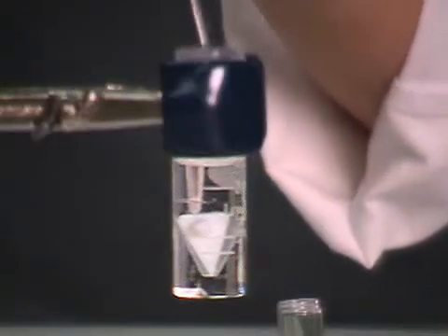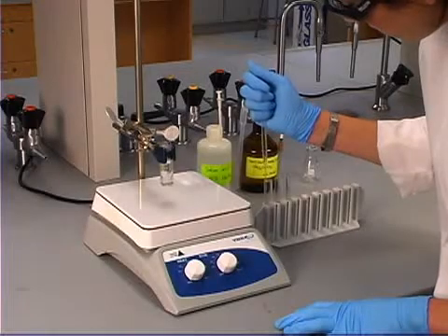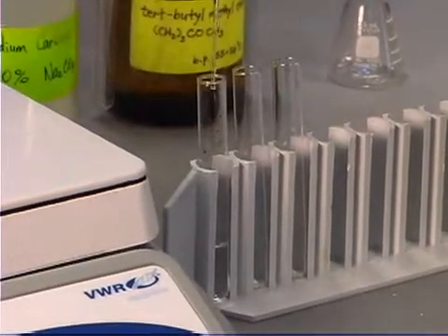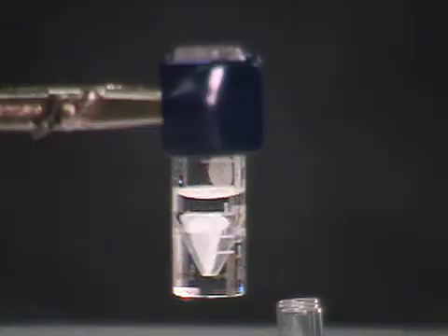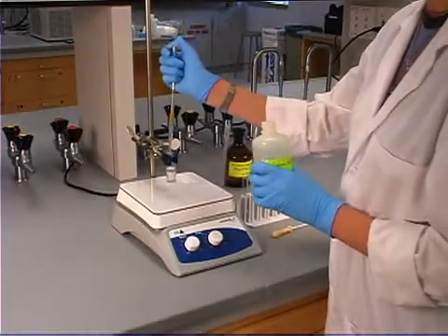Remove the aqueous layer from the conical vial. Start the magnetic stir plate, and then wash the organic layer with additional portions of aqueous base.